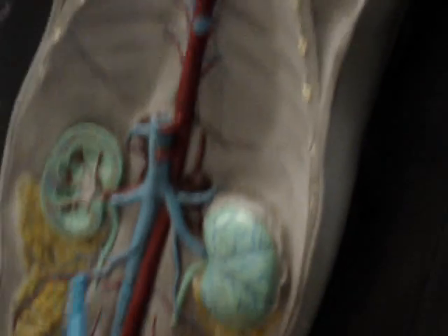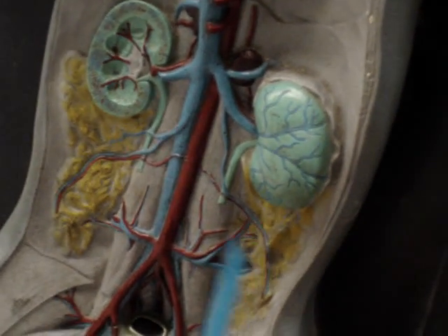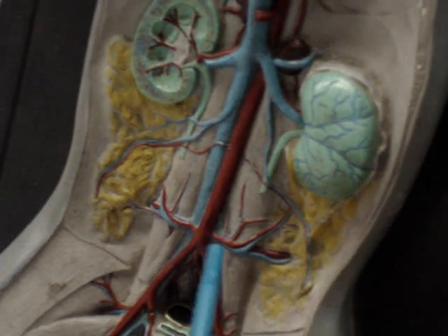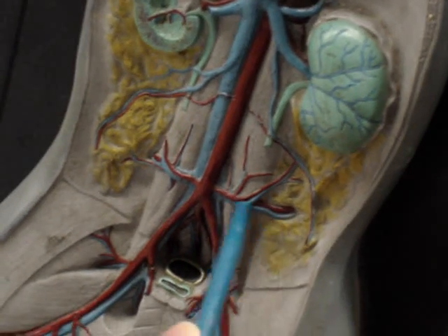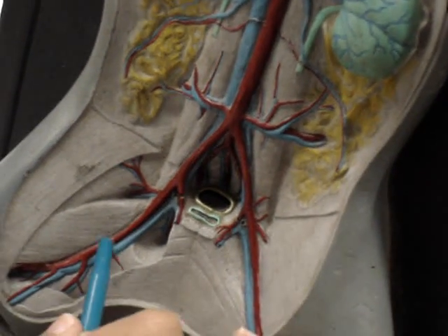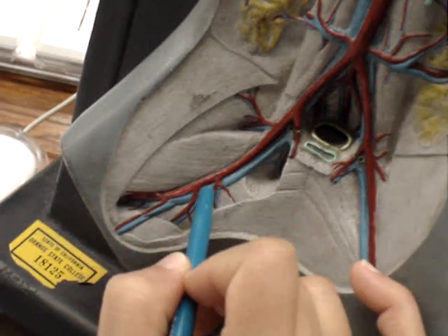These are the gonadal arteries and veins here. And this one here is the iliolumbar artery and veins. Coming here, this would be the femoral artery and vein.